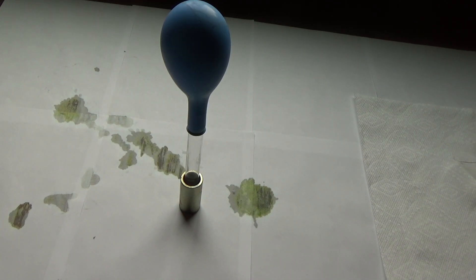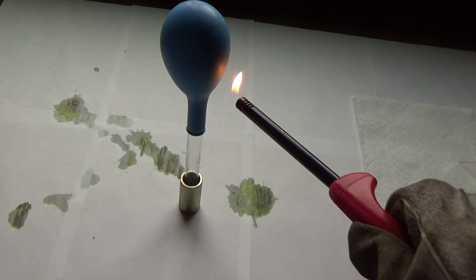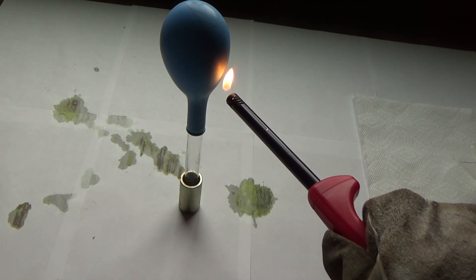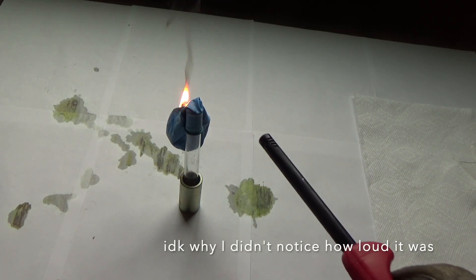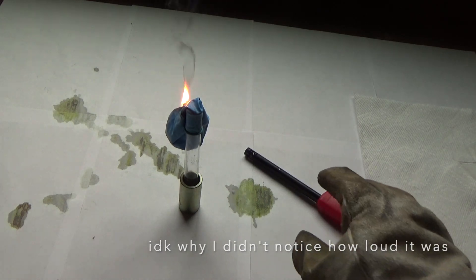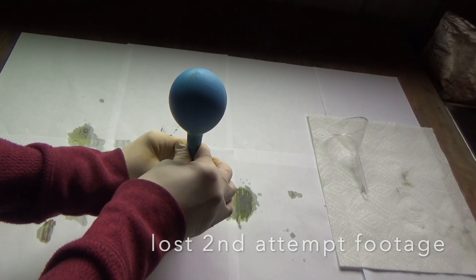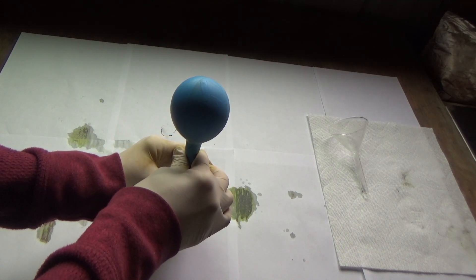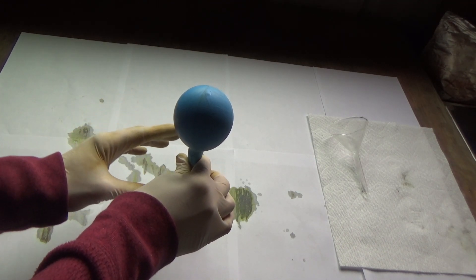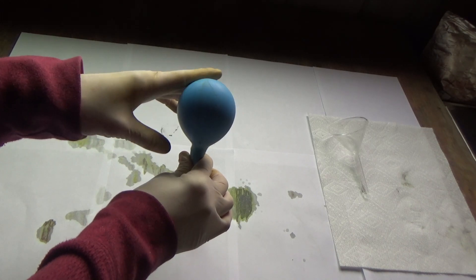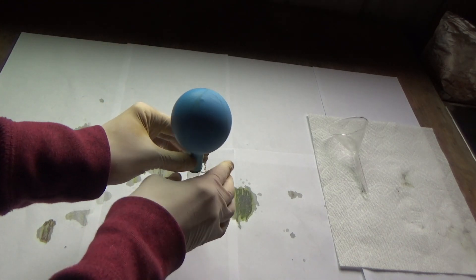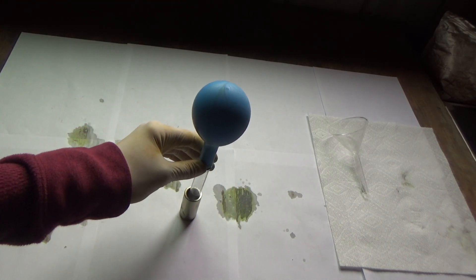Okay, now that the reaction has for the most part calmed down, I am going to see if I can light the hydrogen. I'm going to do this experiment for a third time now. So I have had a realization that this balloon can only hold a certain amount of pressure. And that all the hydrogen gas is just sort of coming out.